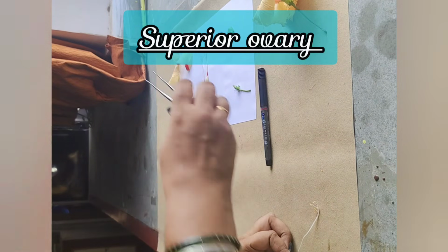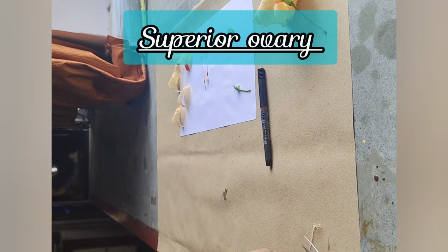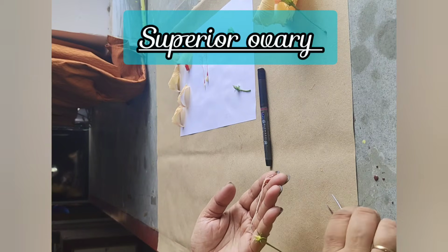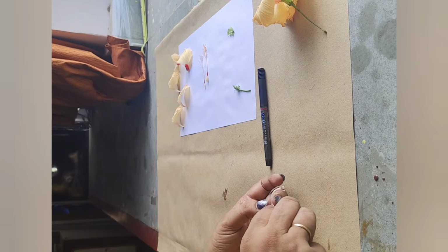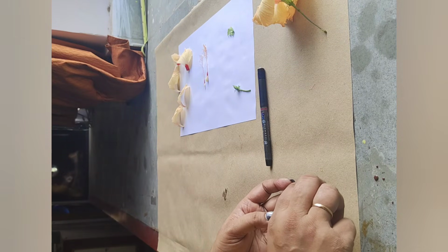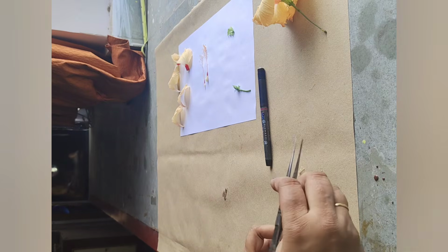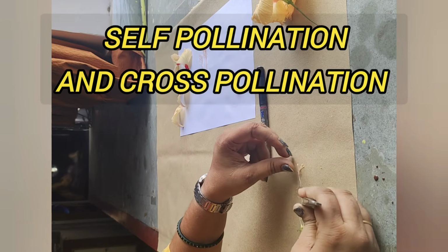Now, this hibiscus flower has a superior ovary. Superior ovary means that the calyx and the corolla are present below the ovary. Now, as you can see, we have carefully removed the staminal tube and the androecium portion of the flower, and we are left with the last whorl, that is the gynoecium.